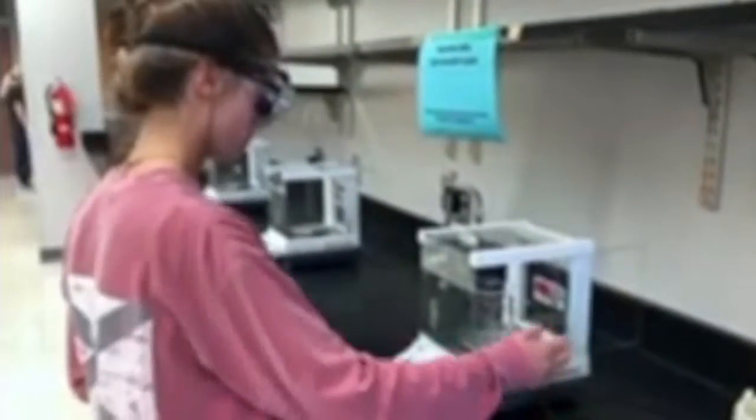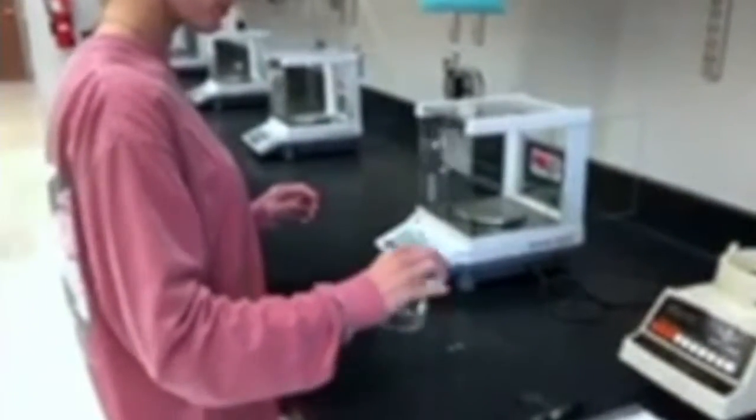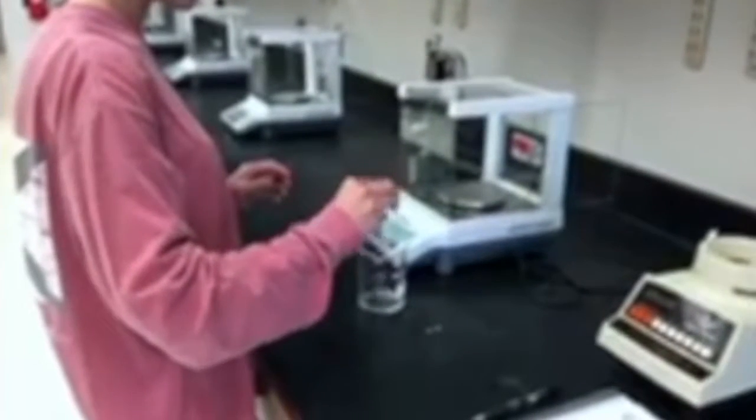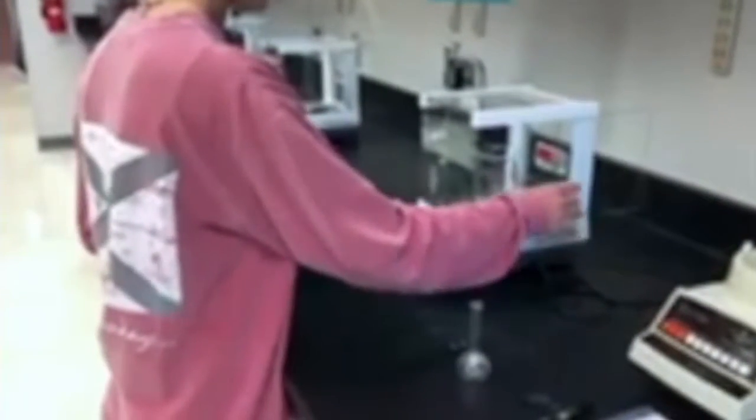And after getting the volume of the 20% solution, which was 9.09 milliliters, we need to get the mass. First, you need to weigh your beaker with nothing inside, then calculate the difference in mass with the solution inside it. Once we have the mass and volume, we can calculate the density, which is D equals grams over milliliters, and so the density equals 1.25. Make sure that you are recording all your data, calculations, mass and volume in a lab notebook like we are, so you can keep track of your calculations.